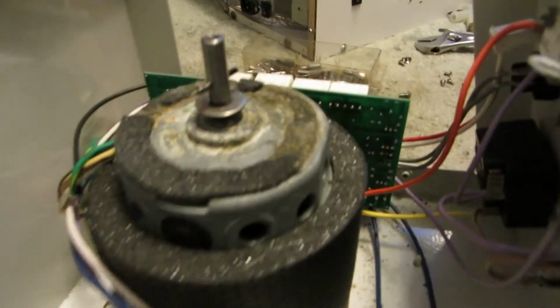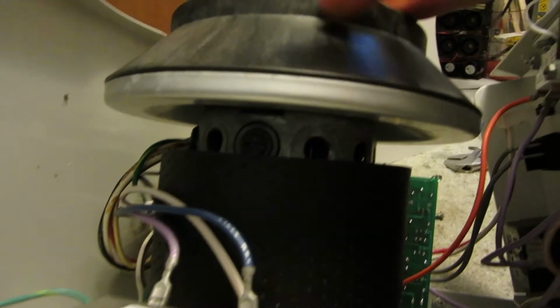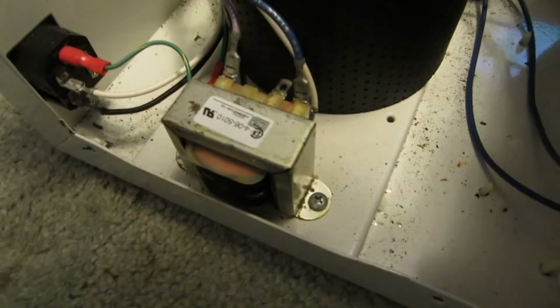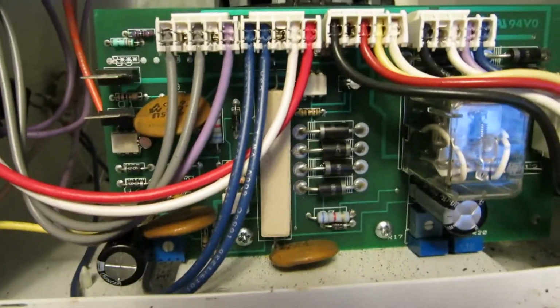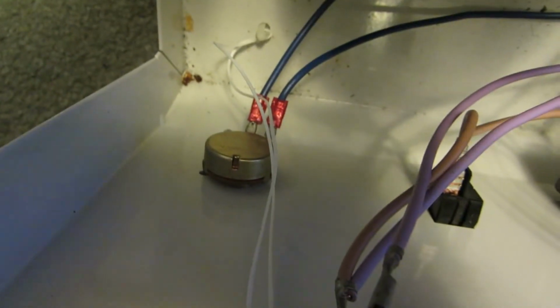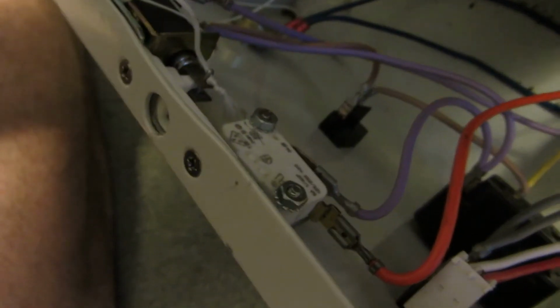And there's your motor. So it's basically just a direct drive setup in here. A little transformer there. That must run these electronics. That must be part of your braking system in there. There's your rheostat for your speed control. Timer, LED, lid switch there. Safety switch and lock.